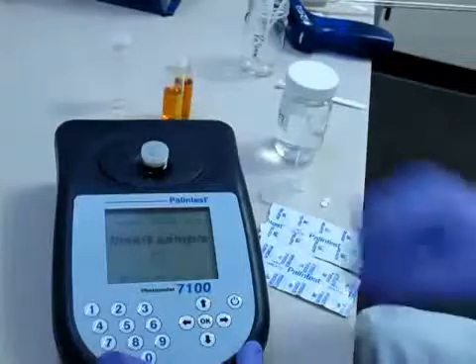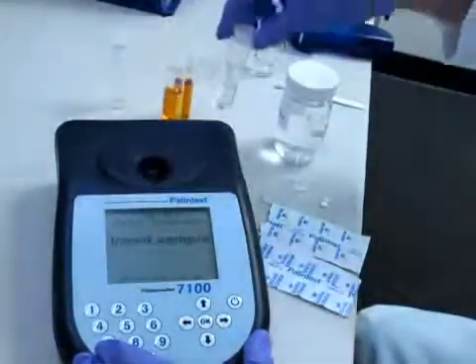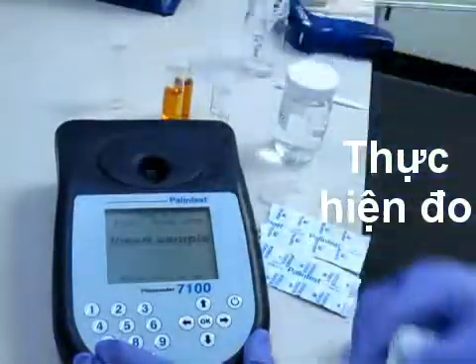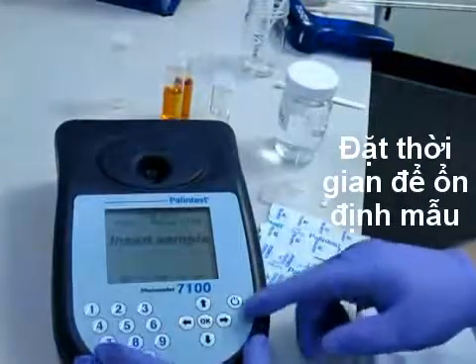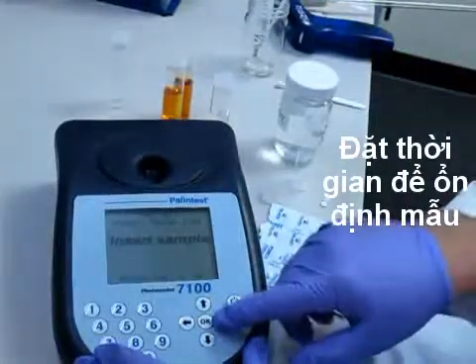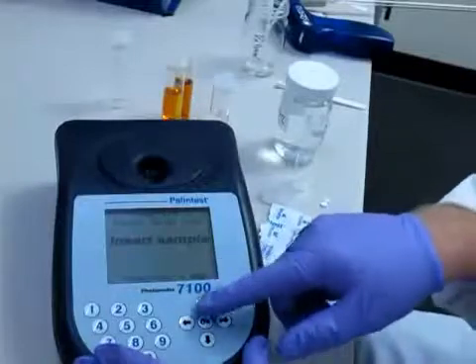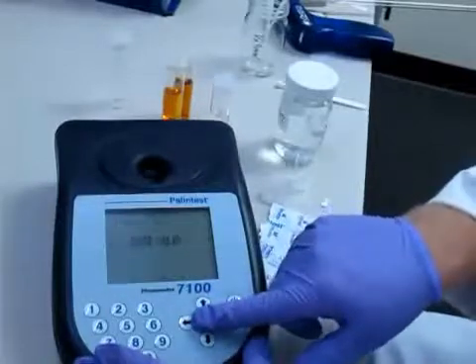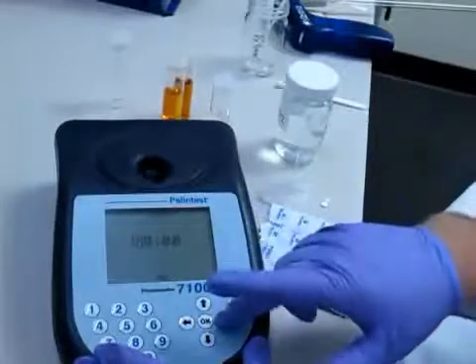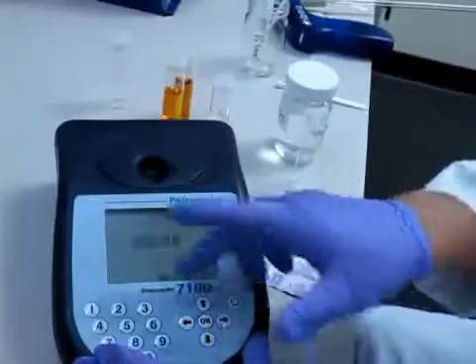Now it will prompt you to insert the sample. For this test it's a two-minute time test, so I'm going to go over to the timer and select ok, and then set the timer for two minutes. Toggle over to 2 and press 2 for two minutes.